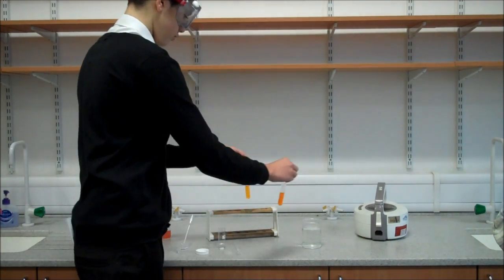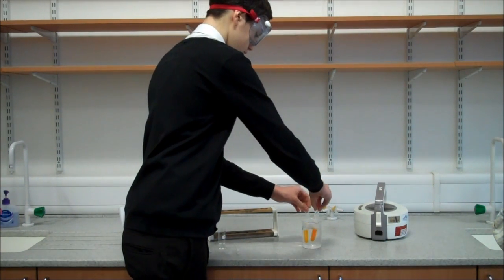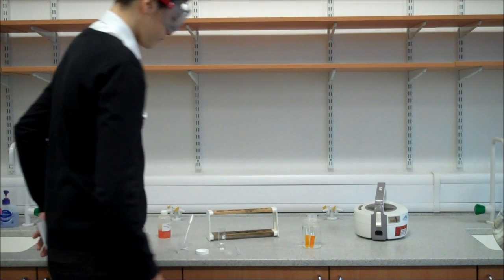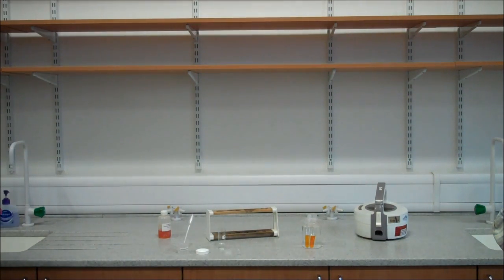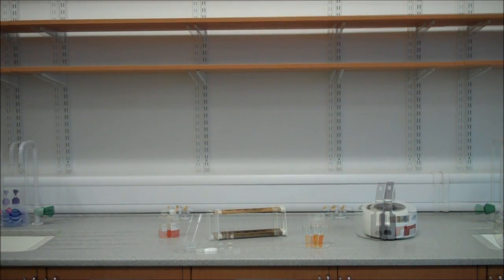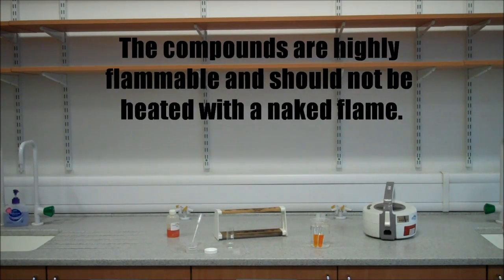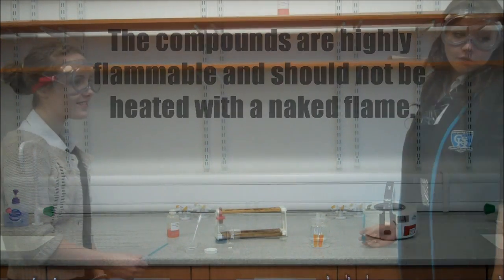These reagents require the mixture to be heated, so we place both test tubes in a beaker and observe and record any changes. The compounds must not be heated with a naked flame as they are highly flammable, so we are using a water bath.